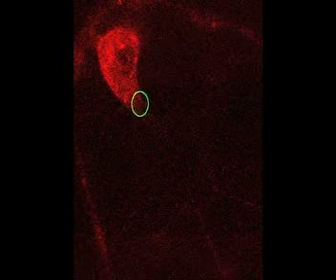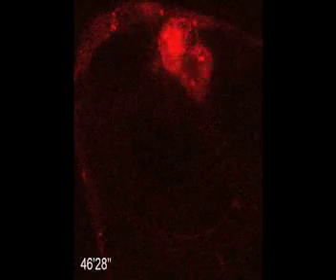Number 3 is the first real experiment here. This is a really fun movie because the normal direction of migration would be from the upper left to the lower right corner, and these cells start moving in that direction. But then Chabot shines the light off to the side, and now the whole cluster by 45 minutes is off to the side of the egg chamber. And this is something that you would just never observe in either of the control situations. They migrate actually all the way to the side of the egg chamber.